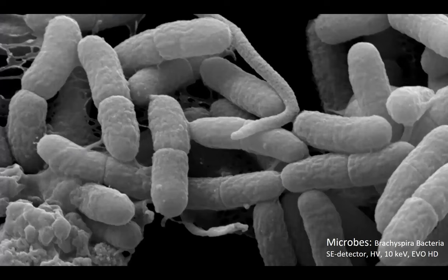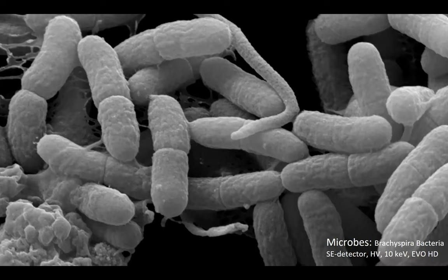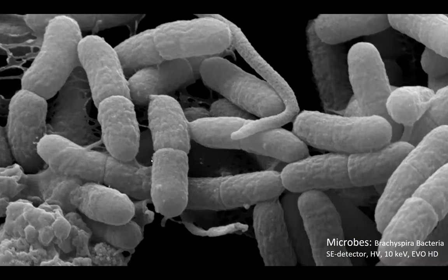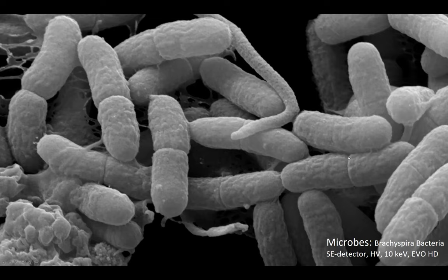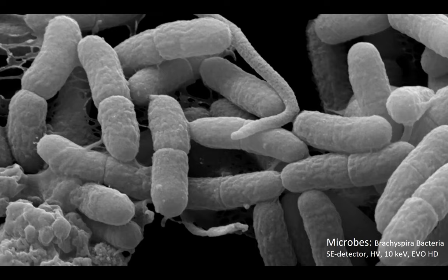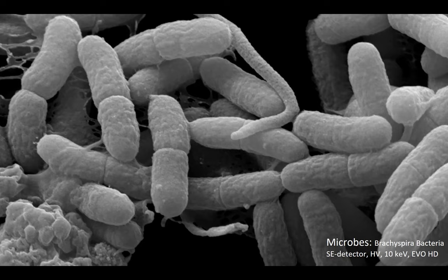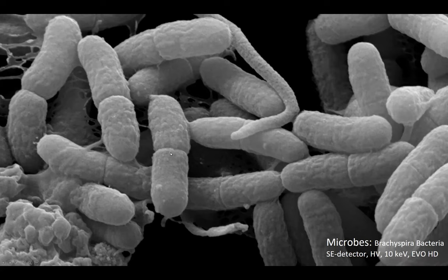This is a classical scanning electron microscope image — probably how SEMs were used for the first 20 or 30 years. This is an example of bacteria where you can see the septum being formed. The SEM is perfect for mutant analysis where you can treat cells or tissues, genetically change them or treat them with compounds, and see what effect it has on the surface. You can get very high-resolution surface details of the sample.